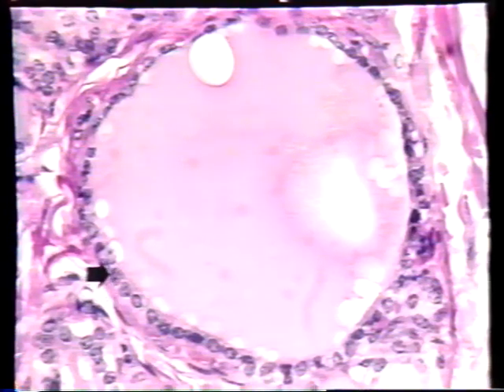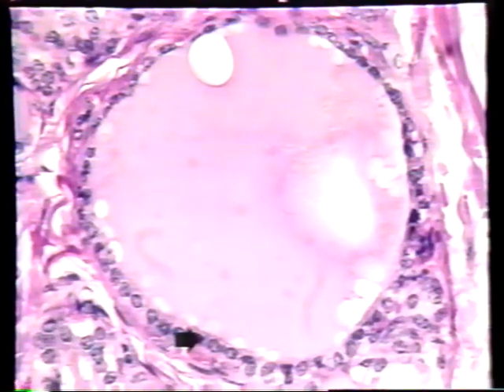And again, the simple cuboidal epithelium consists of a row of cells that are roughly as wide as they are high, that are spread in a monolayer. All of the cells contact the basement membrane. There's one thing that's a bit problematic with the nomenclature, and that is the following. If you look carefully, some of the cells, like these, look rather flat, and some of these down here look rather tall, and yet it's all defined as a simple cuboidal epithelium.